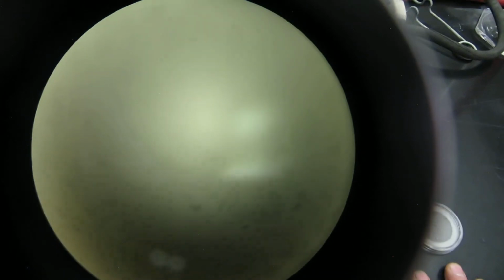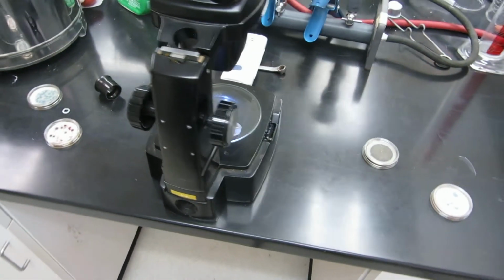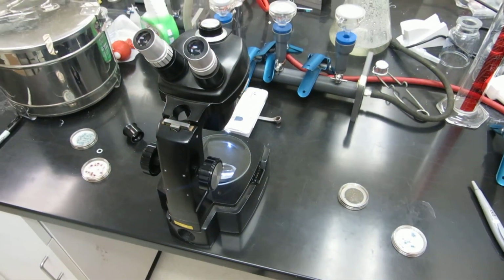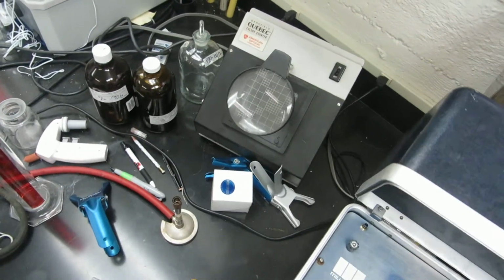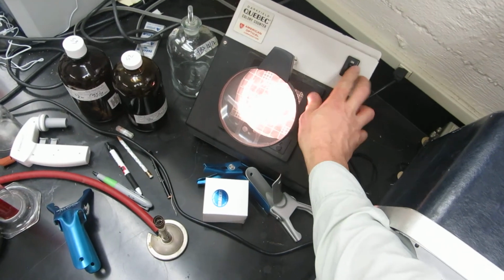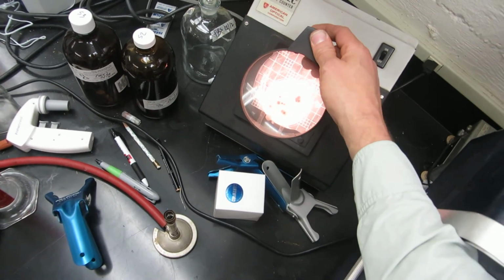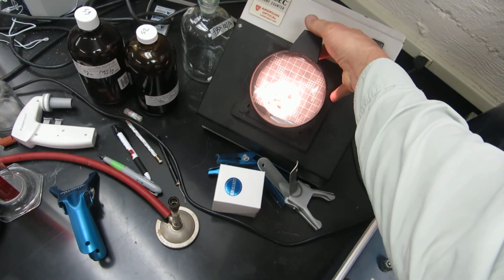Okay, so that's the dissection microscope with the mEI and mTEC. Now let me just show you the setup really quick here. So this is a dissection microscope that I have in the lab. And another thing to do would be to use this guy here. This is a plate counter, and you can take one of these plates and put it in there and then adjust the magnifying glass by pushing it in and out. I don't know if you can see that.